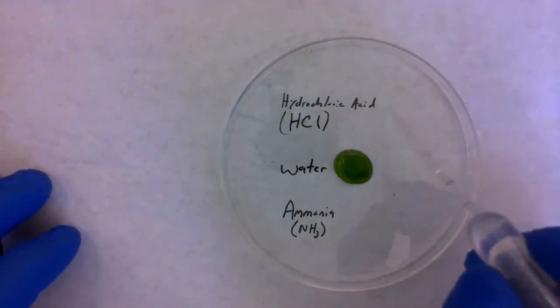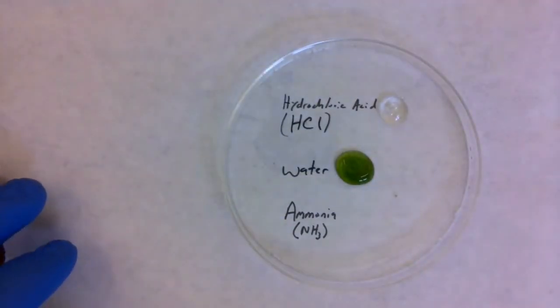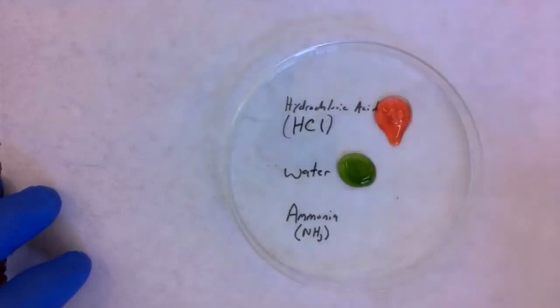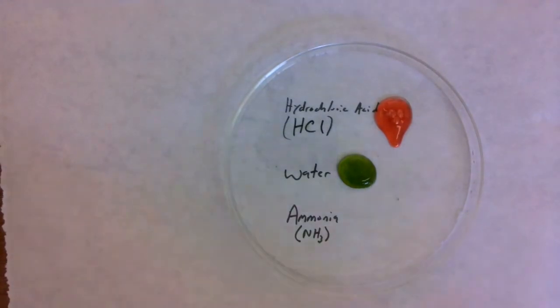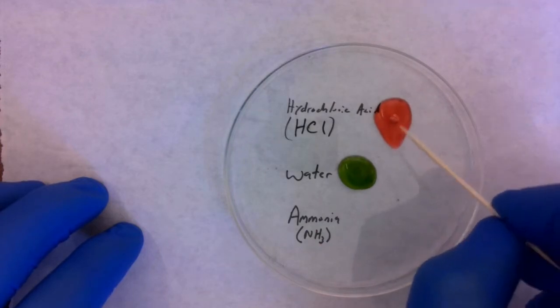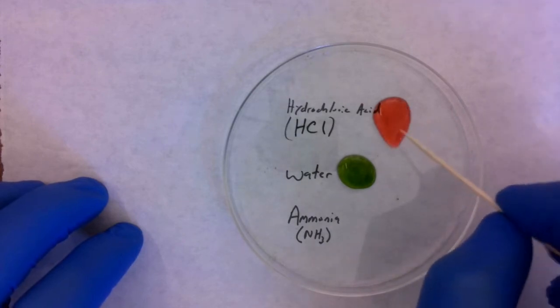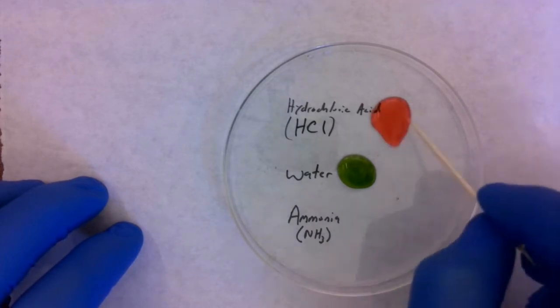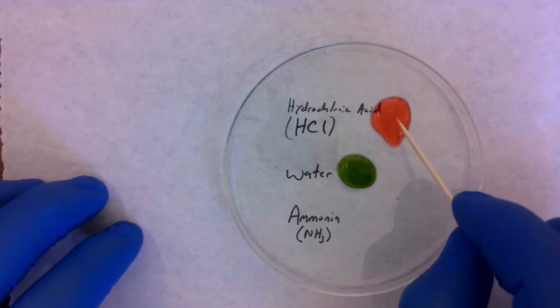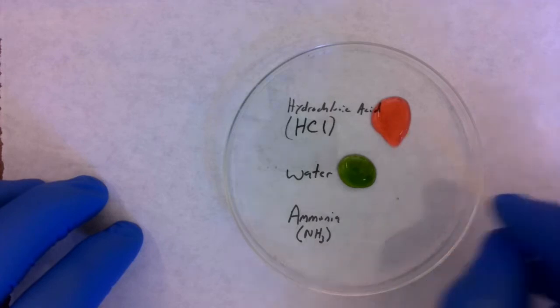Now let's go ahead and test some hydrochloric acid and see what color the universal indicator changes. So I put a little puddle of hydrochloric acid here and add my universal indicator. And we're going to see immediately this is going to change to a red color. So when universal indicator is put into an acidic solution, it's going to change red, or it could change yellow and orange. So that means that it is less than 7 on the pH scale. Usually red for this universal indicator is a 1 or 2 on the pH scale, so that's very acidic.